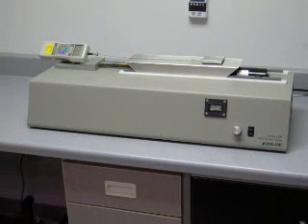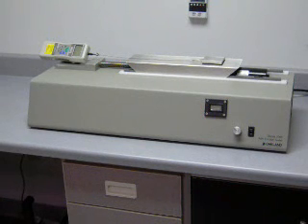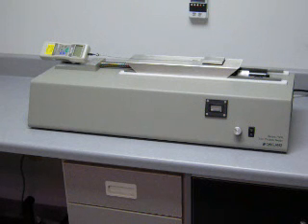The Oakland Instrument Series FX7000 and FX7100 coefficient of friction testers are designed to meet the testing requirements of ASTM D1894 test method for static and kinetic coefficients of friction of plastic film and sheeting. Oakland Instrument manufactures several coefficient of friction tester models that meet the various testing methods specified by ASTM standards.